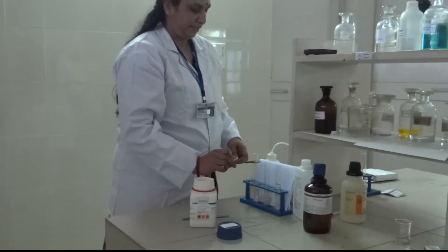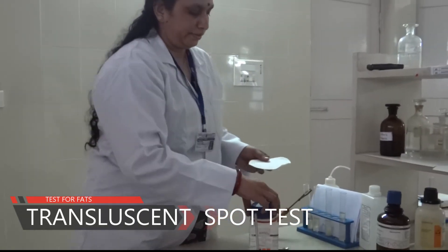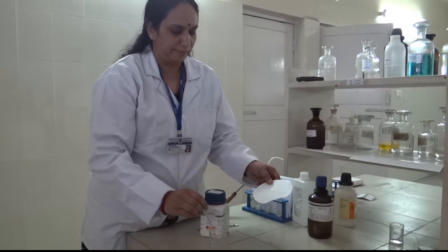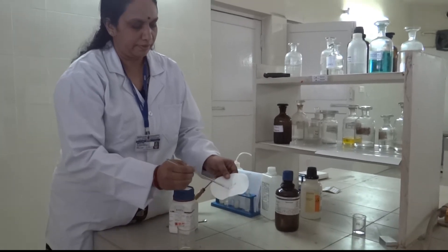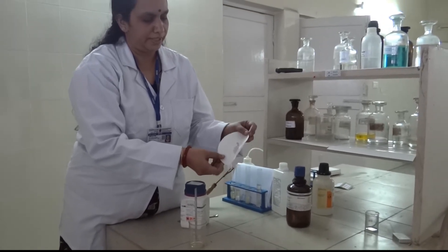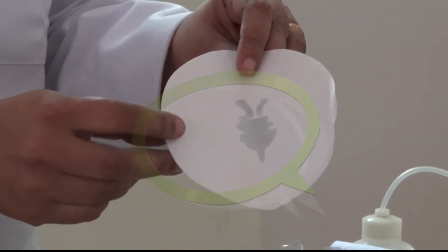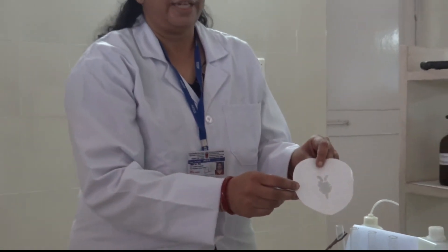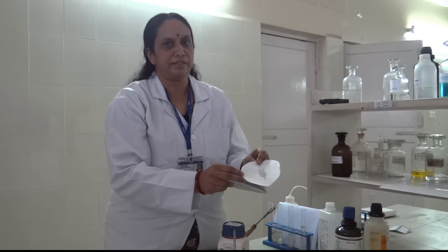Now we come to the third test — the translucent spot test. Take any paper, such as a filter paper, and onto it add a few drops of the sample, then fold it. You can see the presence of a translucent spot formed on the paper, which shows the presence of fat in the foodstuff. You can also do the same test with mustard seeds or peanuts — crush them between the folds of the paper and you will find a translucent spot indicating the presence of fats.